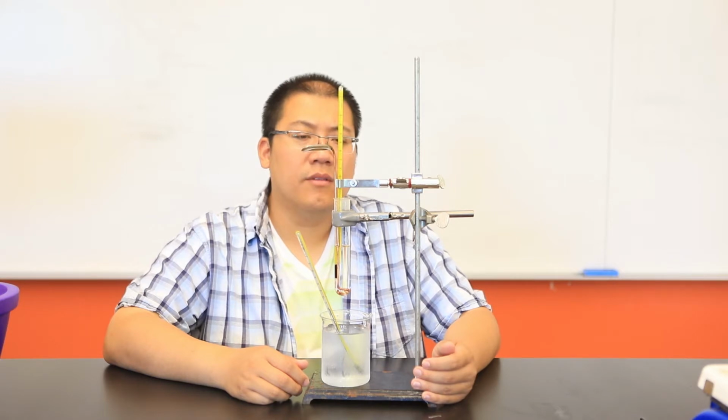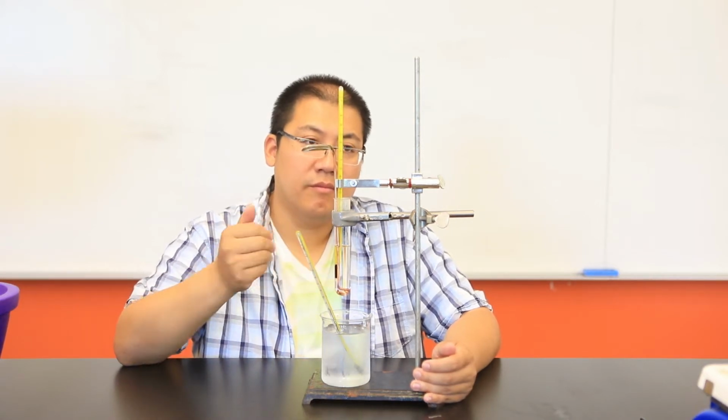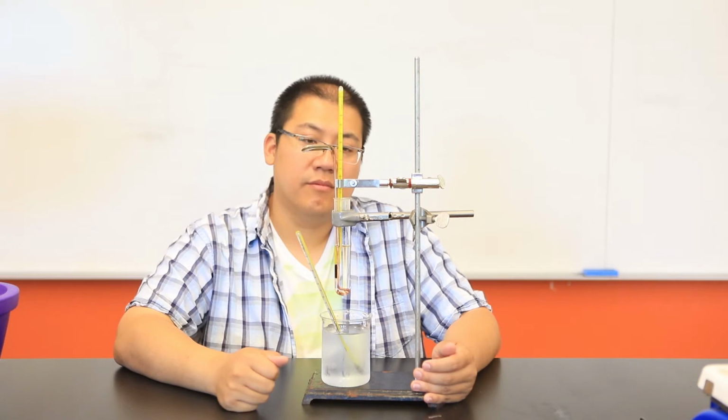And so what I've done is that I started off with a specific volume, and therefore mass, of our pure solvent T-butanol. I added approximately 2 grams of our unknown compound. You can go back and check to make sure you know the exact mass of that unknown compound that was added. And so our goal now is to determine the freezing point of the solution.